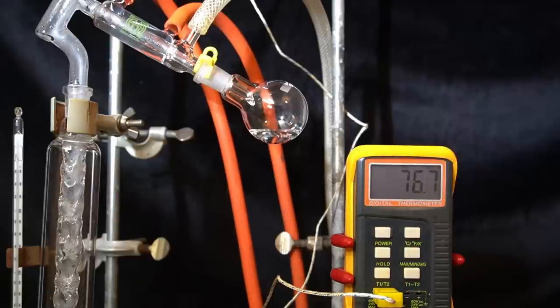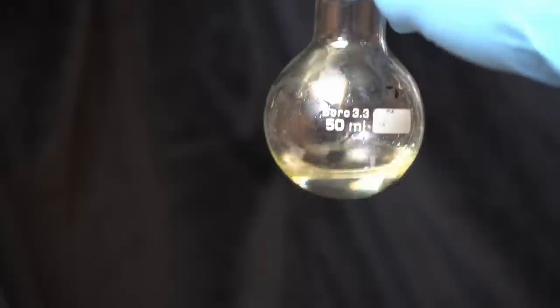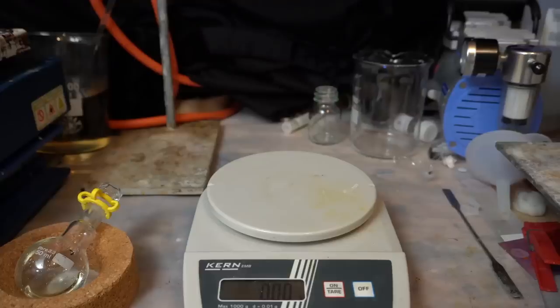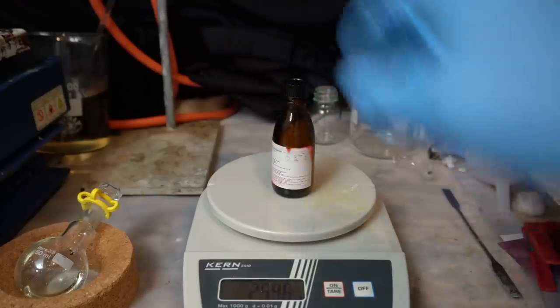Okay, we're done with the distillation and we have a nice colorless oil as our distillate, which is exactly what we want. Now we can calculate the yield and... Yeah, I was not happy with that.